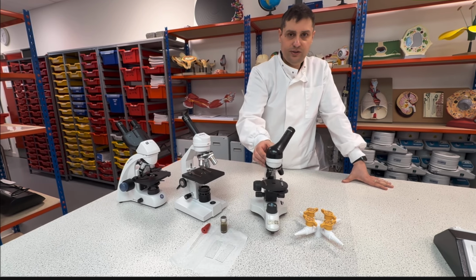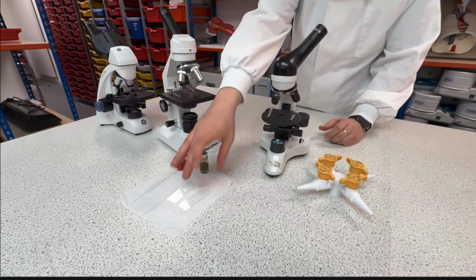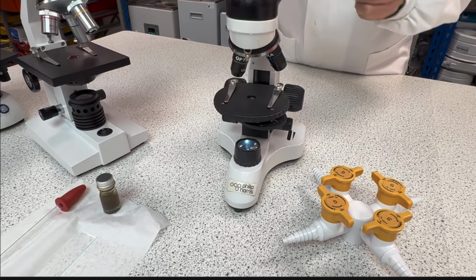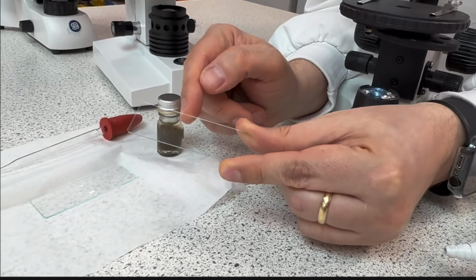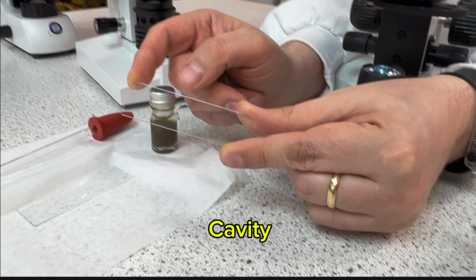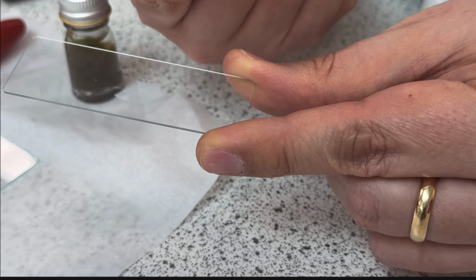So how is this going to work? I will take my microscope, I will place down my stage, and I will take my slide. This is a special slide. As you can see, there is a ring in the middle of the slide. This is called the cavity. Okay, this cavity should always be facing up. Why?